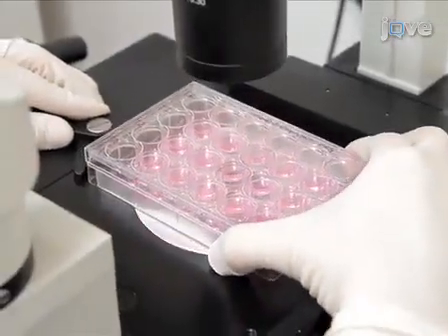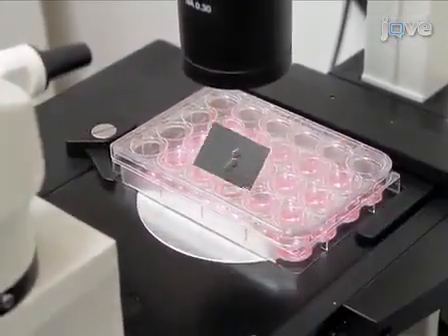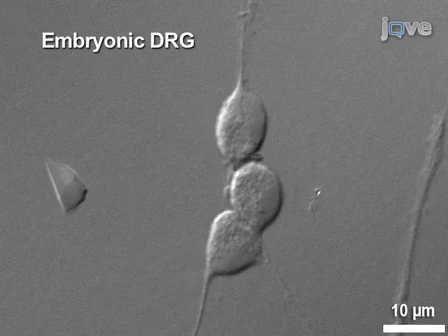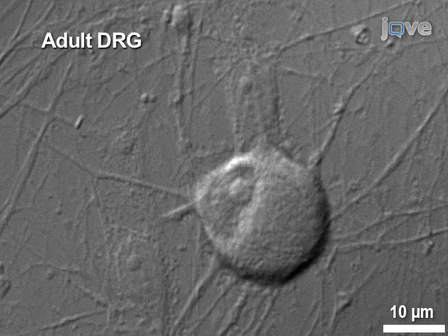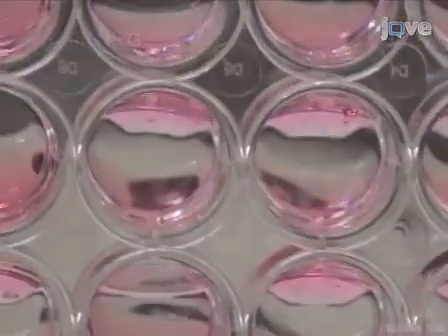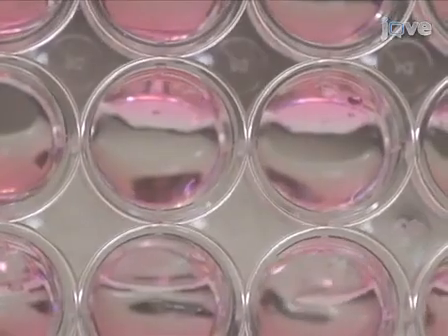This video will demonstrate how to label newly synthesized mitochondrial DNA, abbreviated mtDNA, in dorsal root ganglion neurons that have been grown on sterile 12 millimeter glass cover slips in a 24-well culture plate.